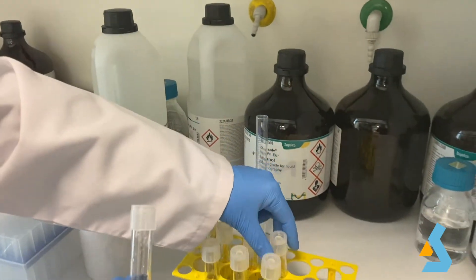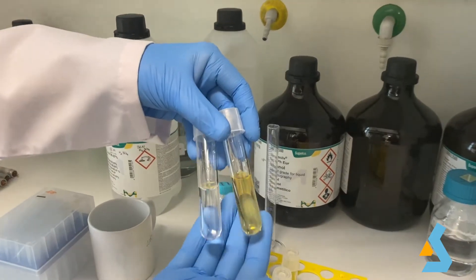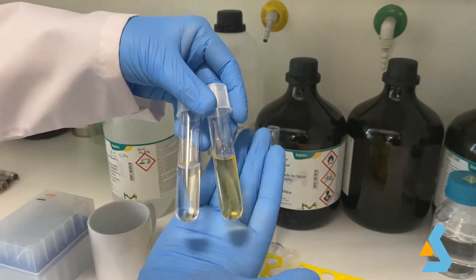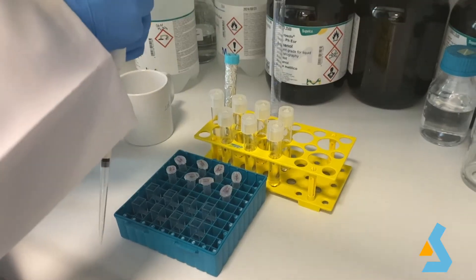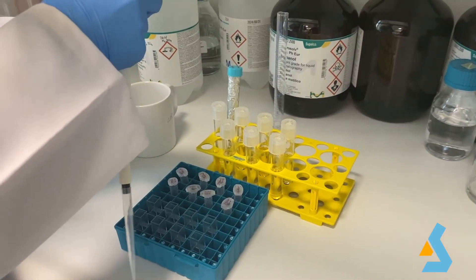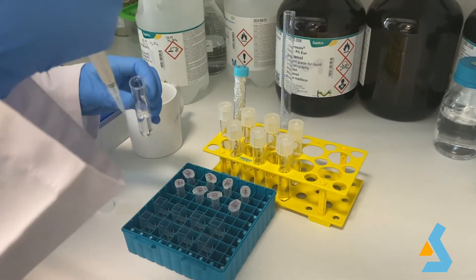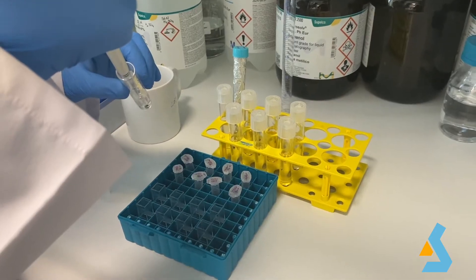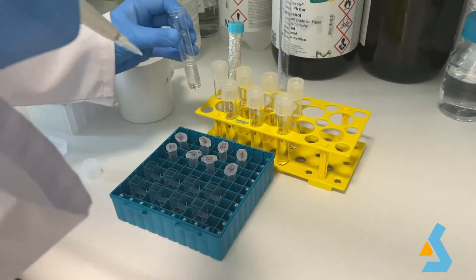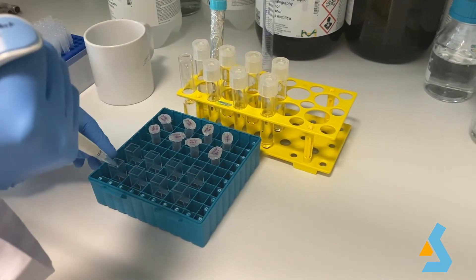After the complete reaction, we can observe the color change with the bare eye, as we can see in yellow. The colored compound is ready to be measured at 490 nanometers wavelength. We take one milliliter from each tube and transfer it into a UV-Vis cuvette.